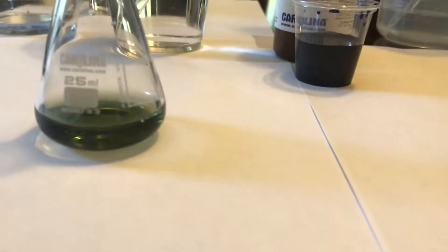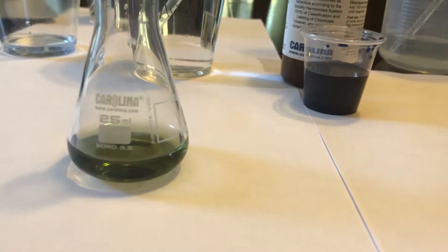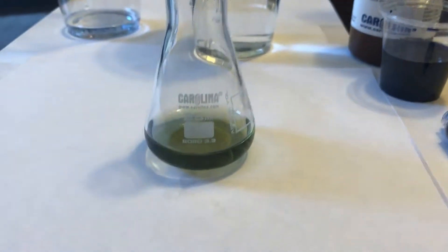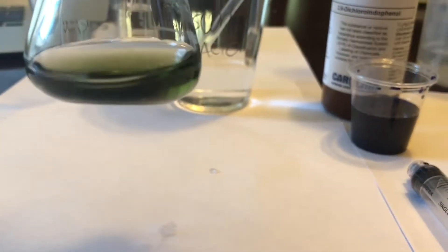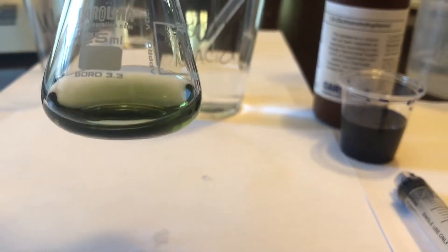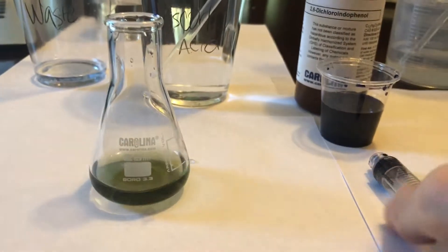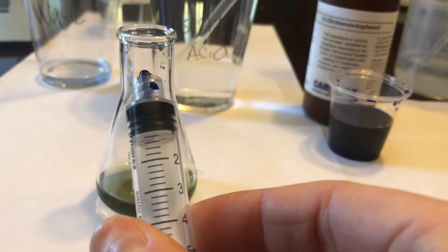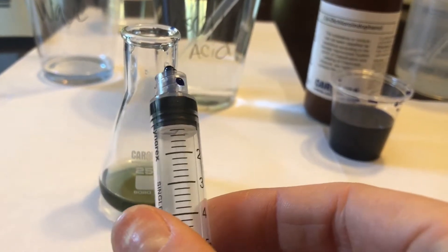I would say that is a good end point — it's green, almost a blue tint. It never got the full blue color, but this is more of a blue-green color, that persistent green color that the lab experiment describes. I only have 0.4 ml left in my syringe, and that's what I'll record in data table 1.